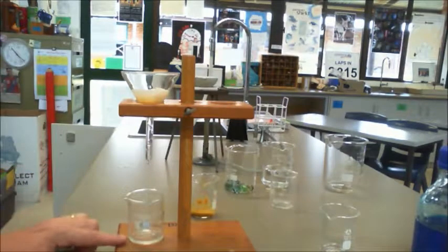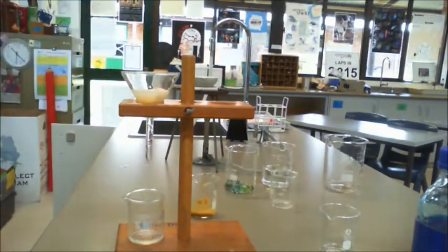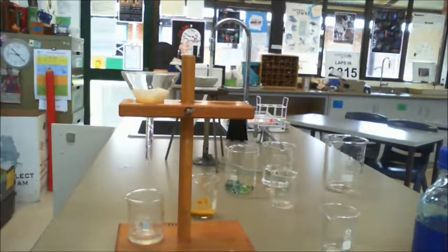Now, what you've got here is the filtrate, and that's the liquid that's left over because that's obviously been filtered. Then up in here you'll have the residue, and the residue is the substance that is left over. So that's your insoluble substance up there. This works really well for filtering and separating very fine particles like sand and the like.